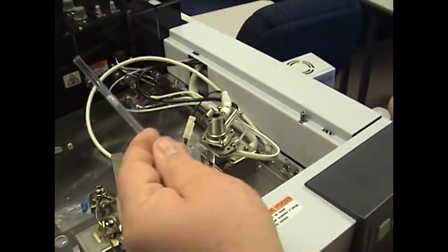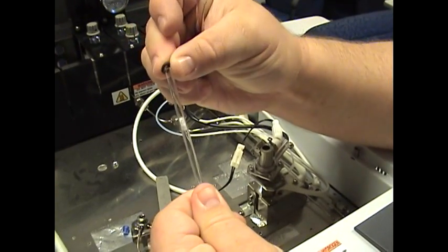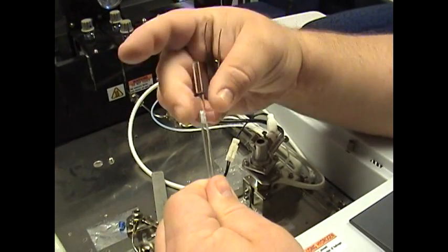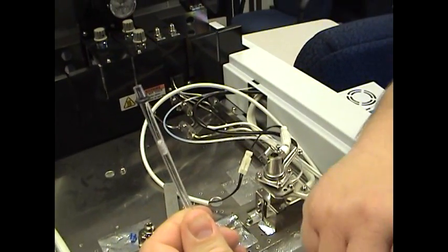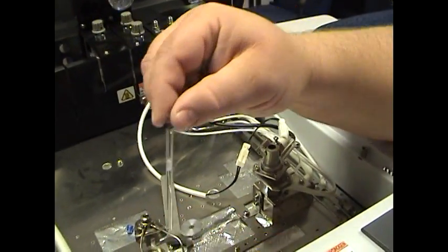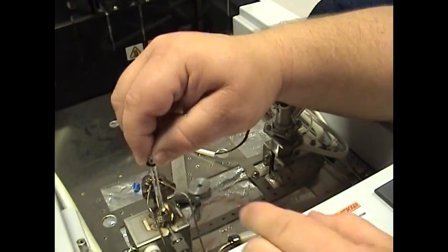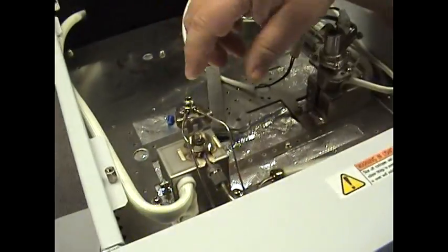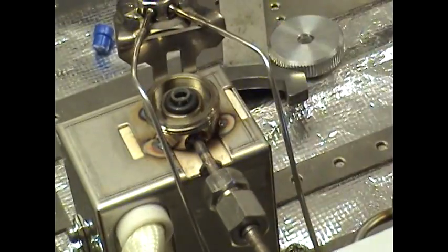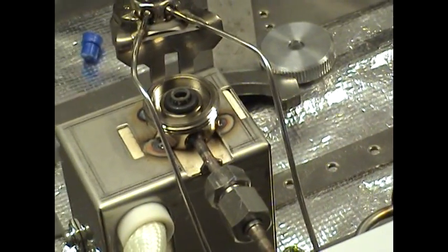Alright, we're going to take a new liner, which looks just like that. Take a new O-ring, place the O-ring on top, push it down approximately 10 millimeters. Of course, if you have rubber gloves, it's best to use rubber gloves or at least use a kim wipe to wipe it off before you put it in there. Next thing we do is gently drop it in there and gently push down until it bottoms out. It will seat itself to the proper height.